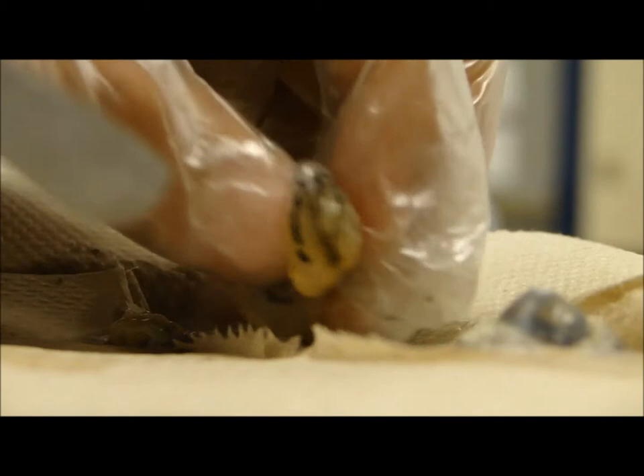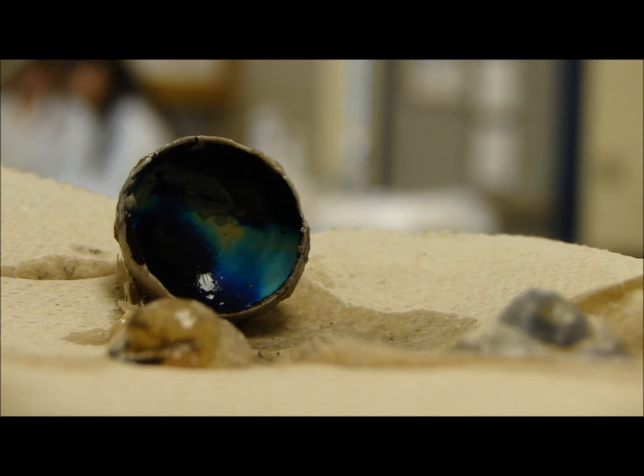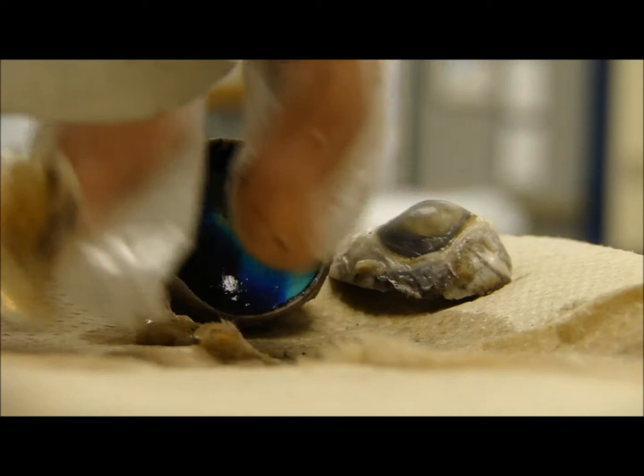The lens is in the middle of that. So do we have to cut it out? Pick up the lens with a pair of forceps. Pat it dry on a paper towel. You might want to place the lens on some printed text or paper and observe its ability to magnify. Oh my gosh, we're doing this. You have to let the lens dry though — pat it dry. Which lens? This thing. So do I scrape it? No, just pick it up with forceps.